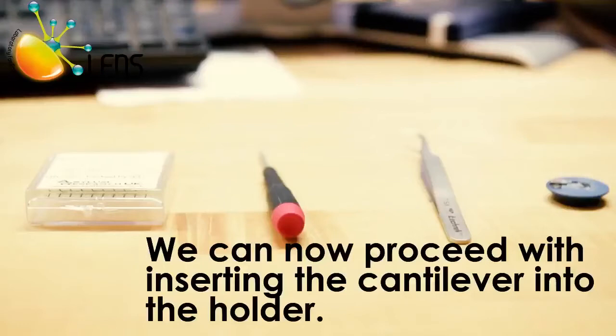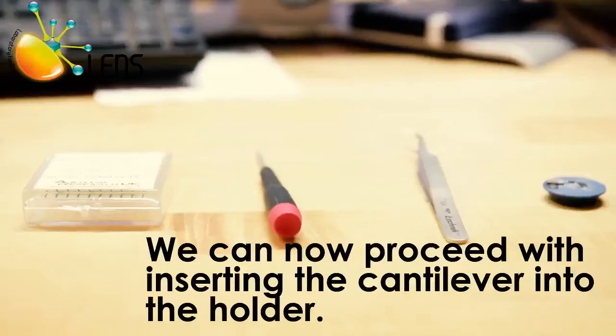After covering these basics, we can now proceed with the insertion of the cantilever into its holder.